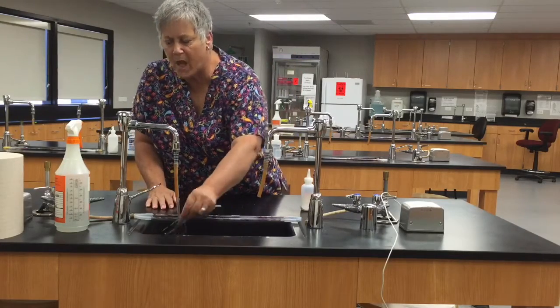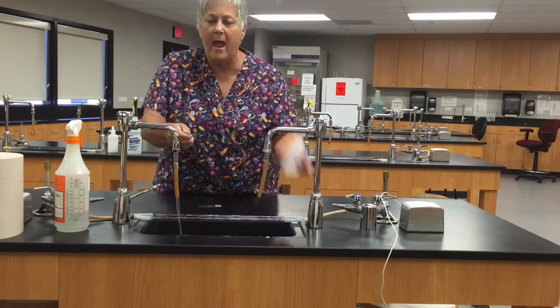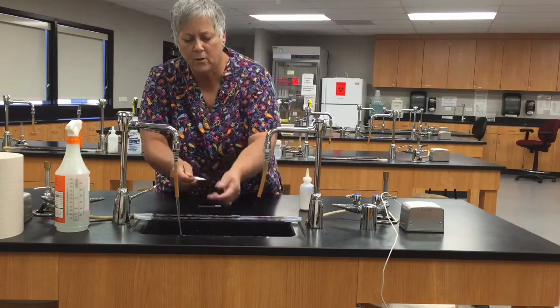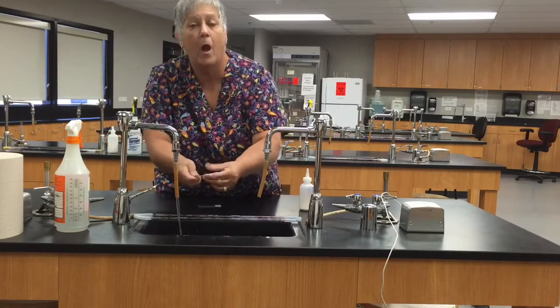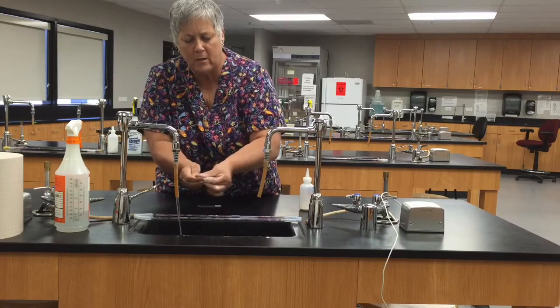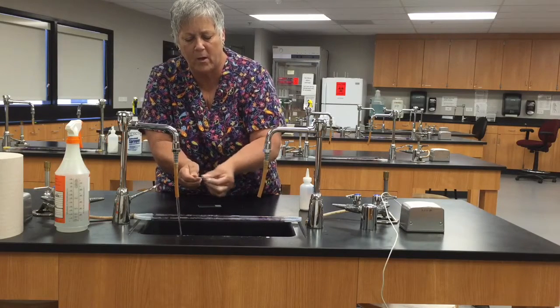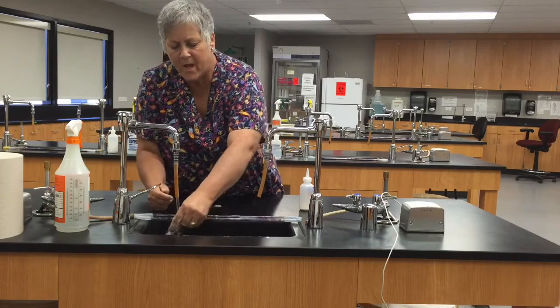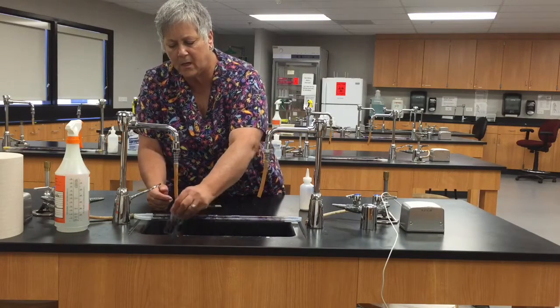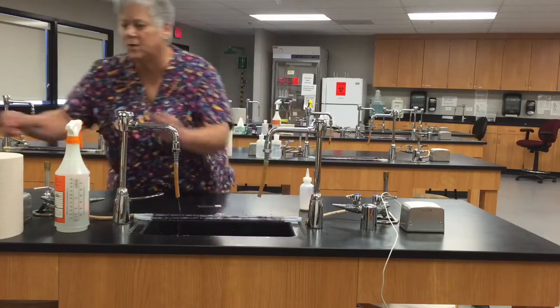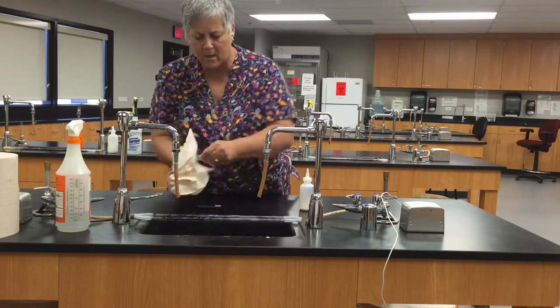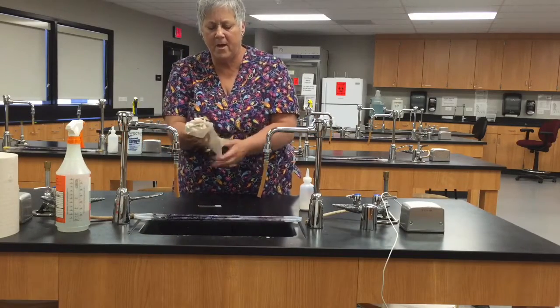Here's what you do, get the slide wet, add a little bit of the cleanser that you will find at your work area and you can just use your fingers for this, just give the slide a really good scrub. I am working it pretty hard here, want to get all of that oily film off of there and then I will rinse the slide in the sink.